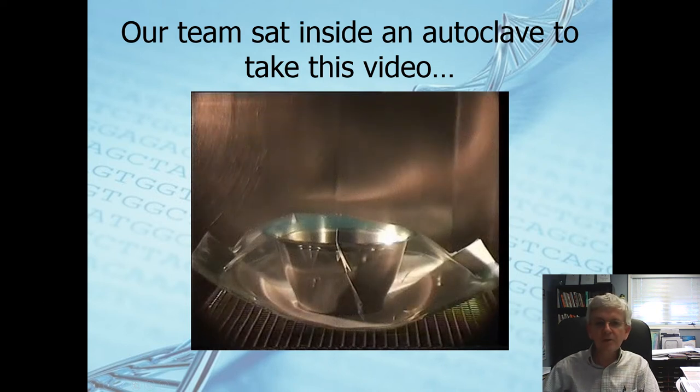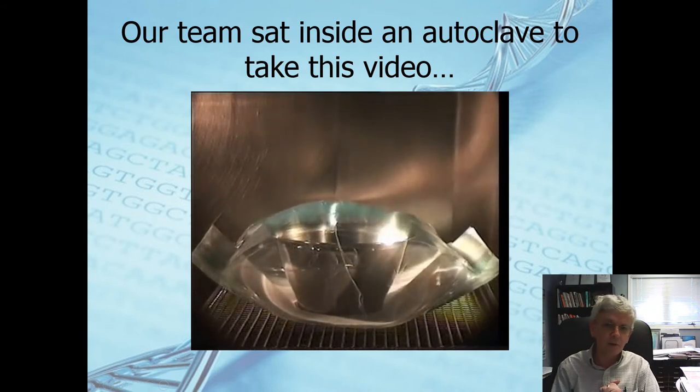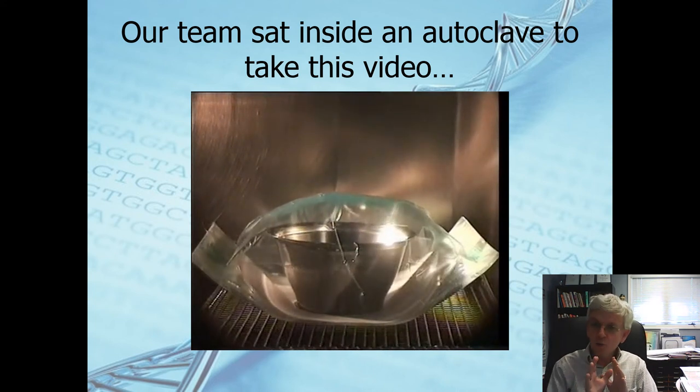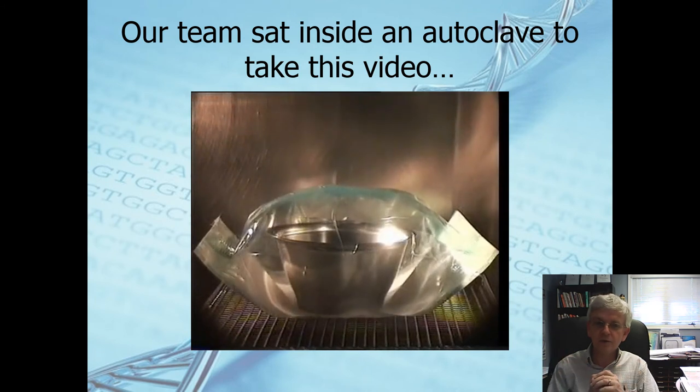Our team of dedicated GMP experts sat inside the autoclave to take this video. Not really. But look at this bag. The pressure inside this autoclave is starting to increase. Look at this.